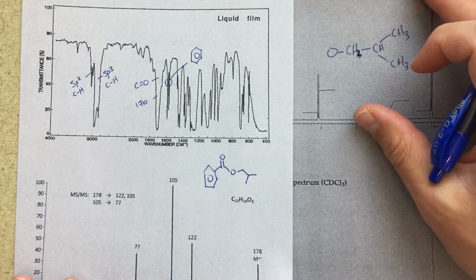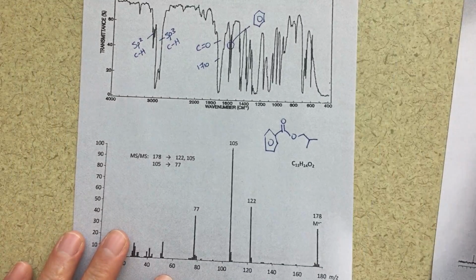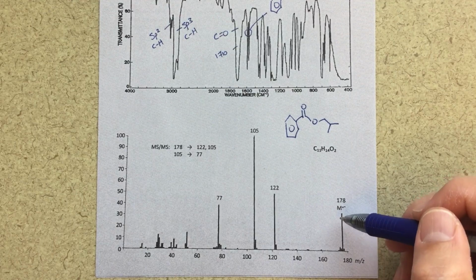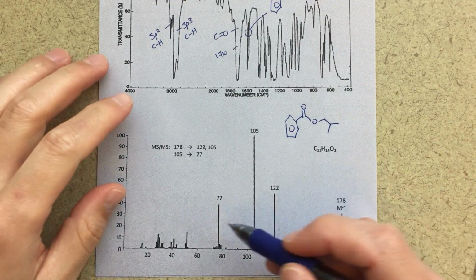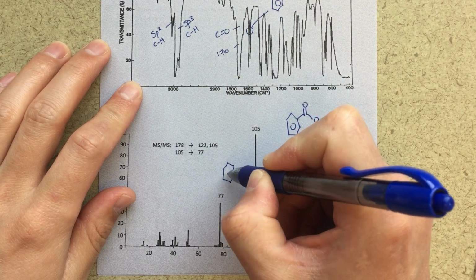Let's go ahead and talk about our mass spec. So this is now time for our confirmation, sort of. If we look at our mass spec, this is our mass peak, and then I should be thinking about fragments that equal these pieces over here. So the most obvious fragment for 77, something that you'll get used to seeing, is just a benzene ring.